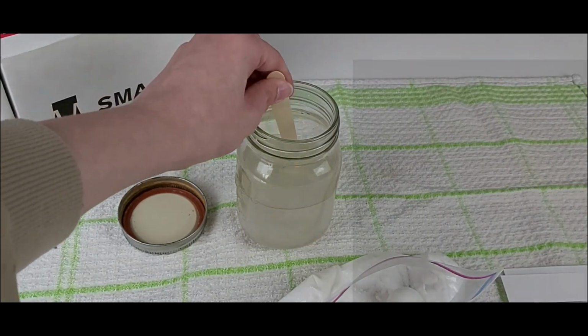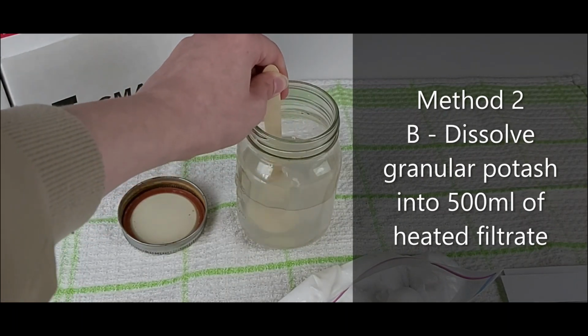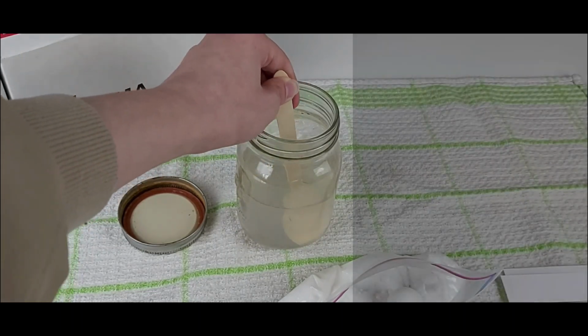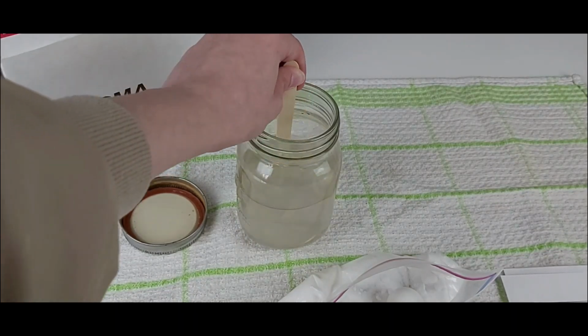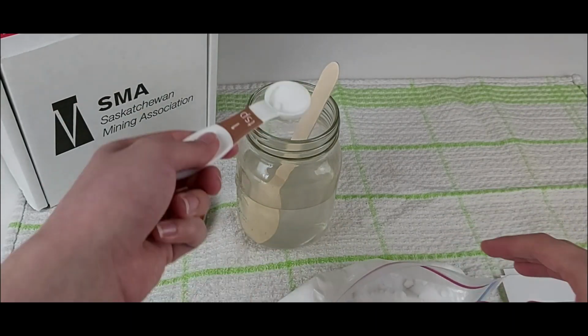Or, by using a hot plate, you can heat 500 milliliters of the filtrate, remove from the heat, and add the granular potash until it no longer dissolves. By heating the solution, it allows more salt to be dissolved, which creates better crystals when cooled. However, you do not need to use heat for either lesson structure.